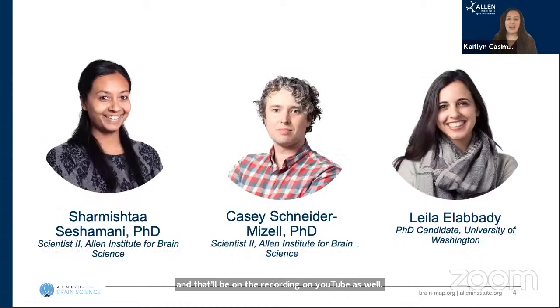Our panelists today, Sharmi, Casey, and Layla, were all involved in the development of the MICrONS Explorer and its analysis tools. They're going to tell you more about their specific work on this project as they demonstrate how you can use it in your work.